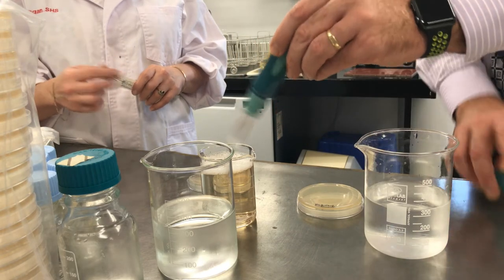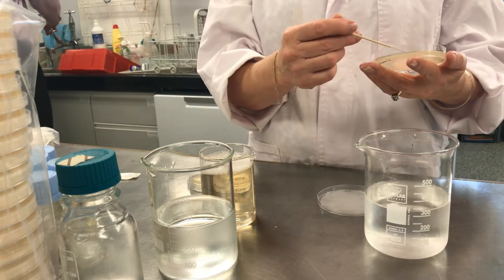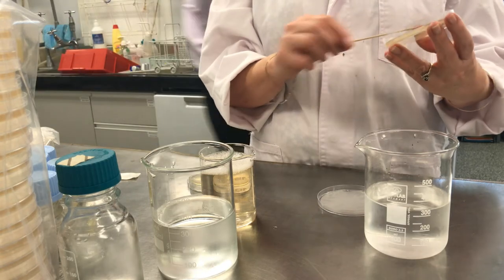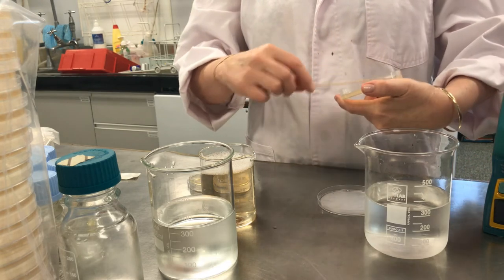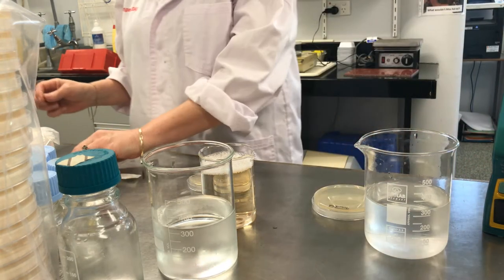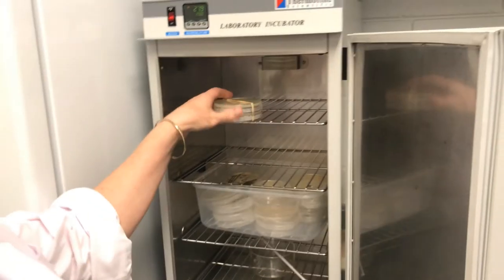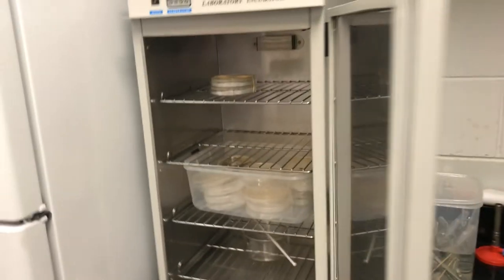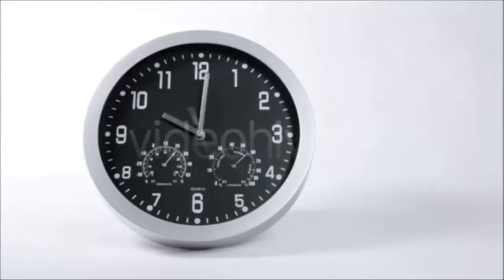While I'm doing that, Deb is going to use another sterile swab to streak our second agar plate with the treated water. She gives it a good mix and streaks the plate, trying to give it nice even coverage. You can see why I enlisted Deb — she's an absolute expert. Now we're going to put these two agar plates into the oven set at 28 degrees.